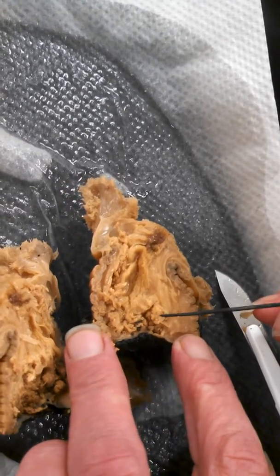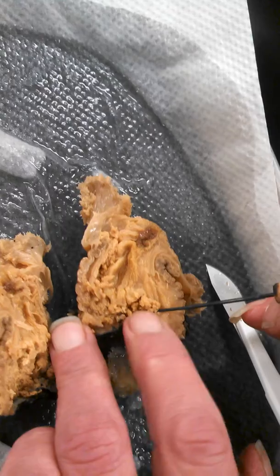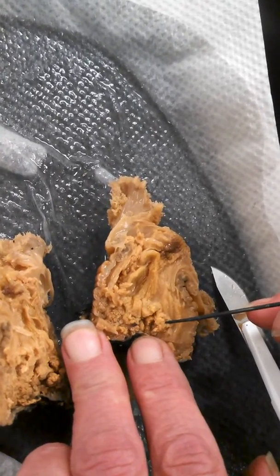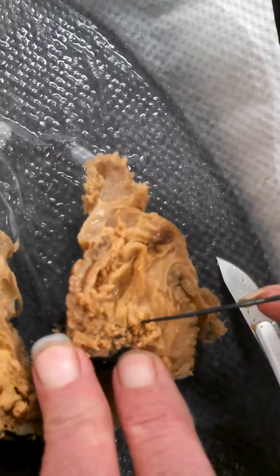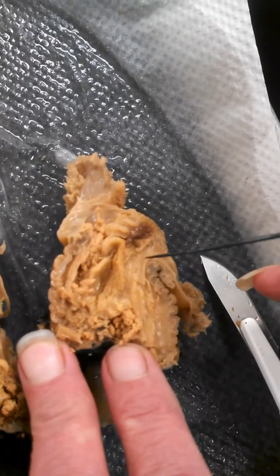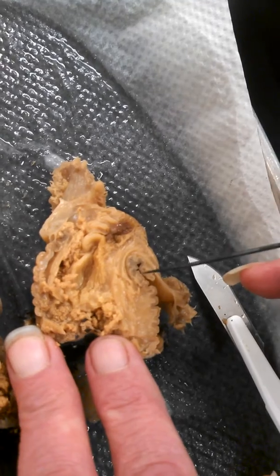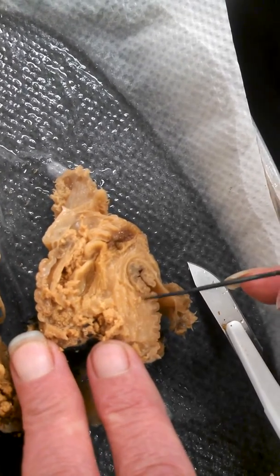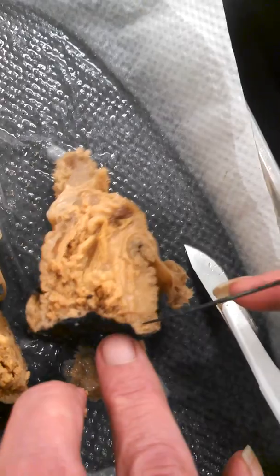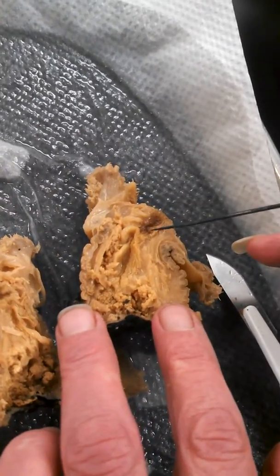Down here, you can see the little kind of tentacles at the bottom — that looks like it's the acontia. This whole cell wall area here is the septum, it looks like. Obviously, the pedal disc is this thingy down here.